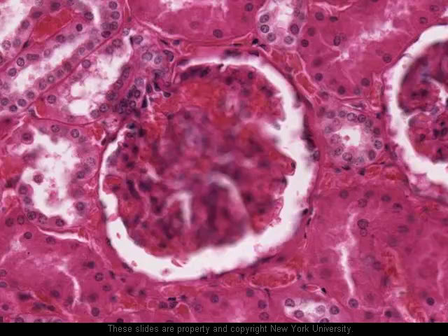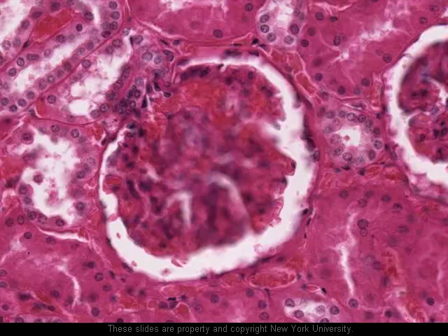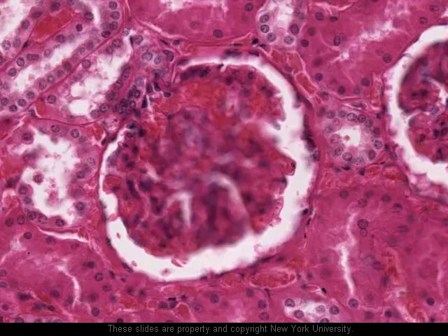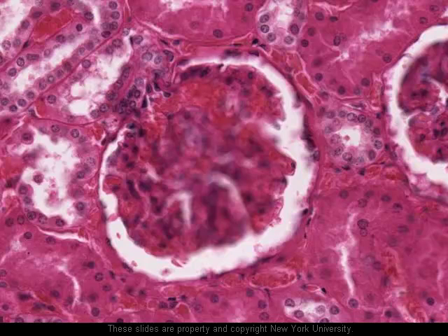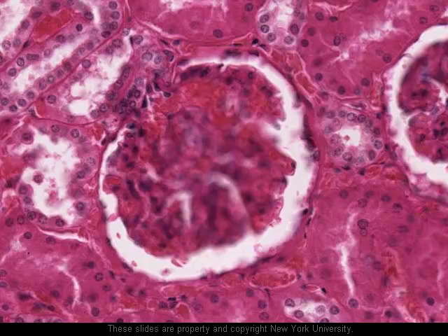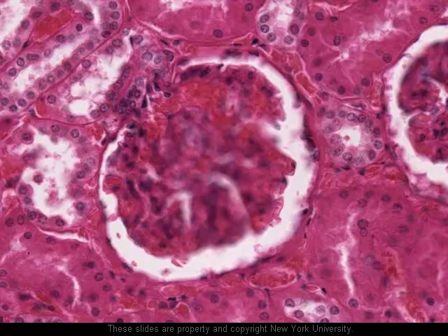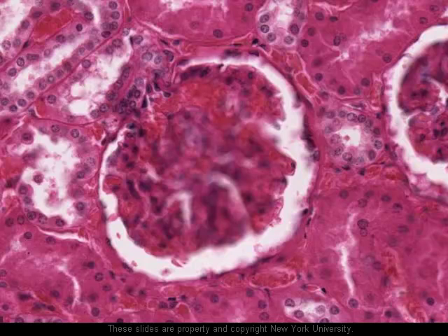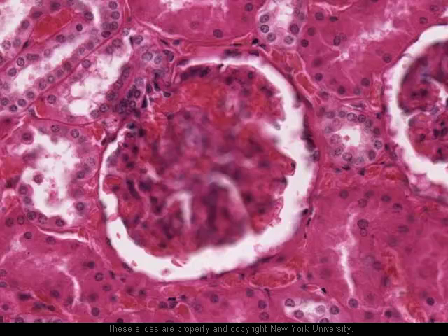Surrounding the glomerulus we see a lot of different types of tubes cut in cross-section, oblique section, and various orientations. These tubes are either proximal convoluted tubules or distal convoluted tubules, or sometimes they may be parts of loops of Henle. It's very difficult to identify all the various tubes from one another unless they present a particularly neat appearance to us.